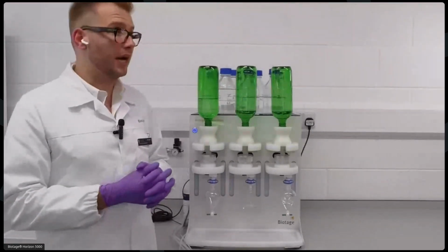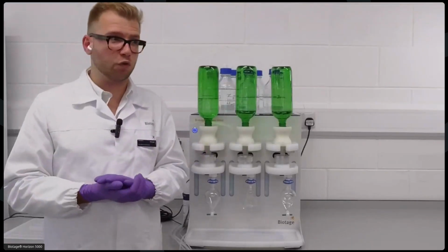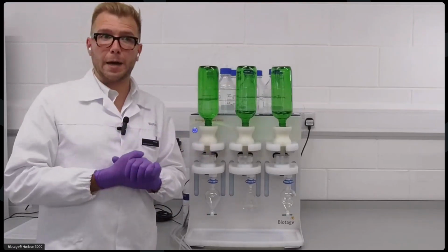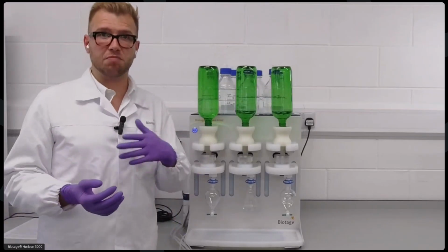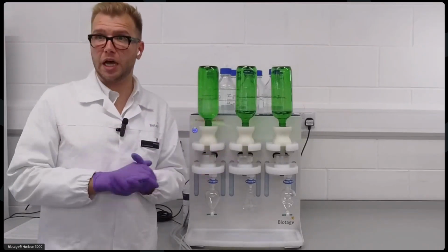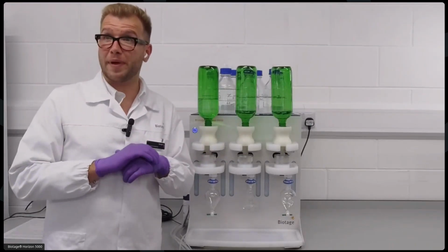Now, as you saw, this is a method for pharmaceuticals in water, and of course the system is great for, as we saw from the poll, many of you analyzing really challenging matrices. But if you're working with cleaner water samples, perhaps drinking water, groundwater, or surface water, we also have a new system that can extract 8 samples simultaneously. That is called the PrepXpert-8.